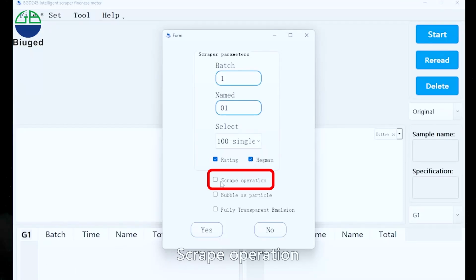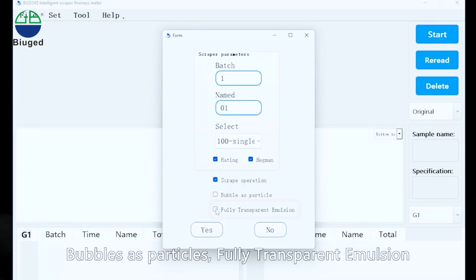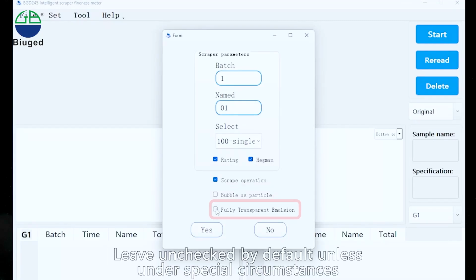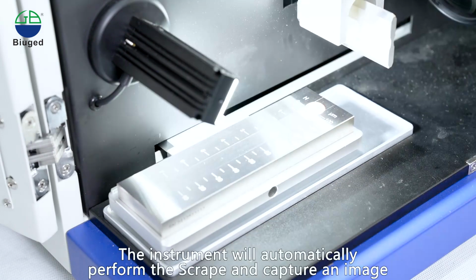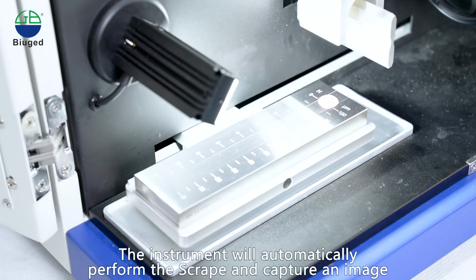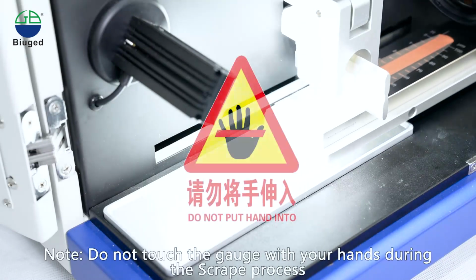Scrape operation. Enabling this function activates automatic scrape operation by the instrument. Bubbles as particles, fully transparent emulsion: leave unchecked by default unless under special circumstances. Click the Yes button. The instrument will automatically perform the drawdown and capture an image. Note: do not touch the gauge with your hands during the drawdown process.